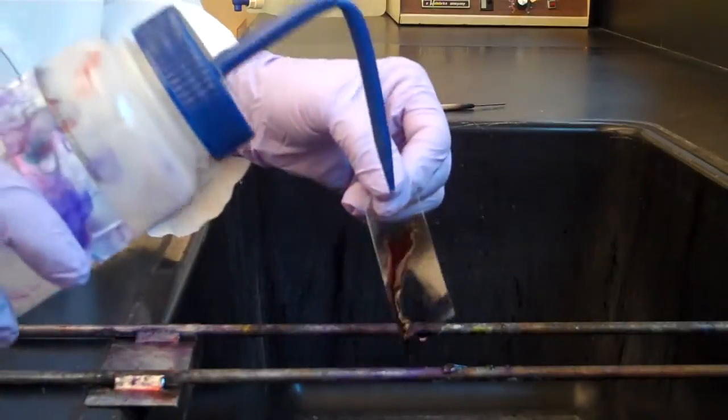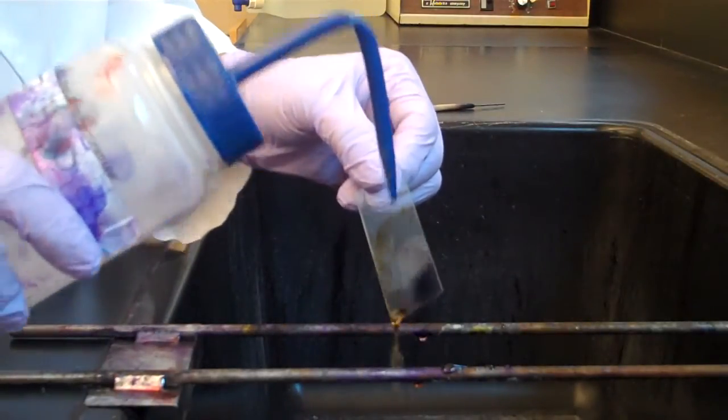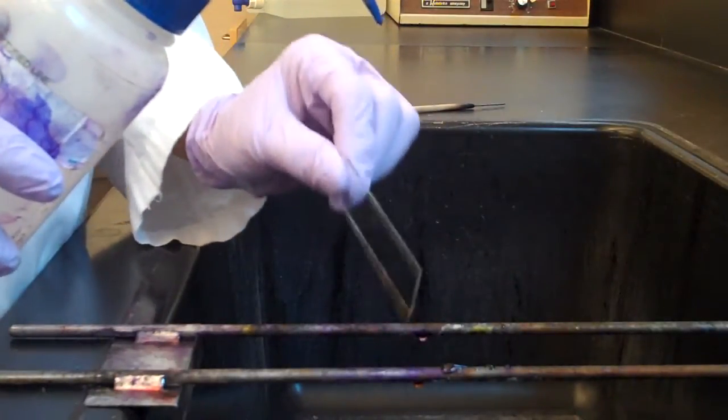Rinse the slide with deionized water and shake excess water from the slide. Now we're going to decolorize the slide.